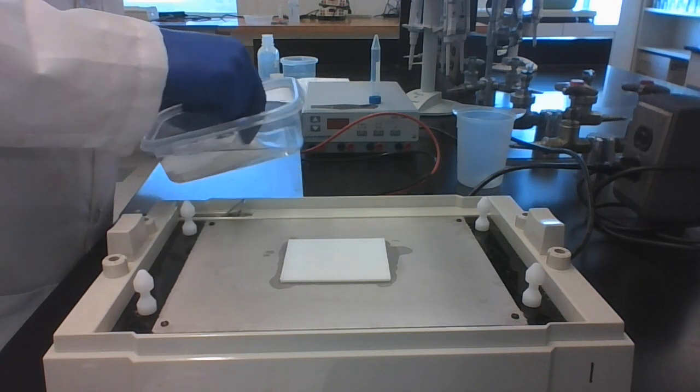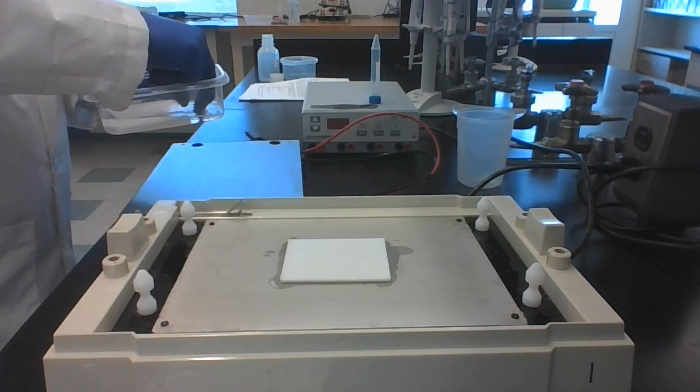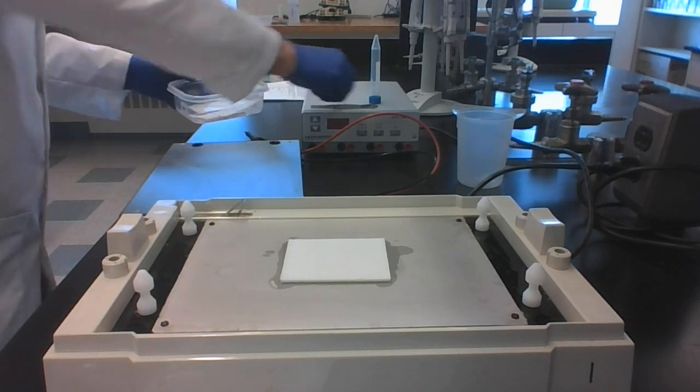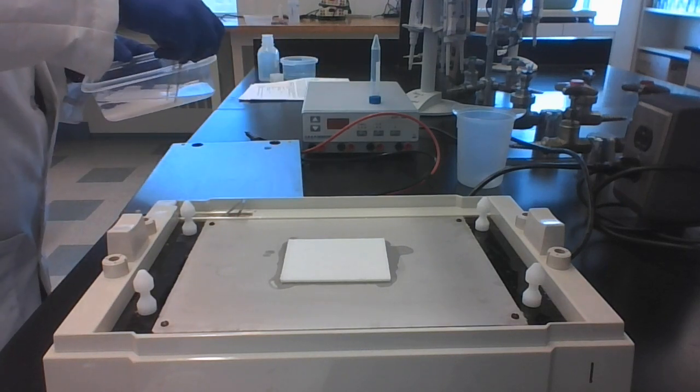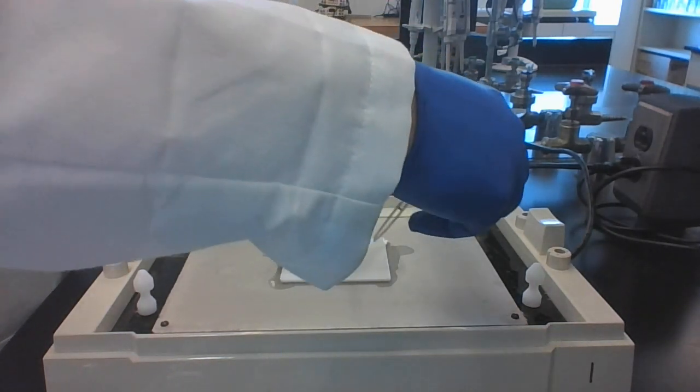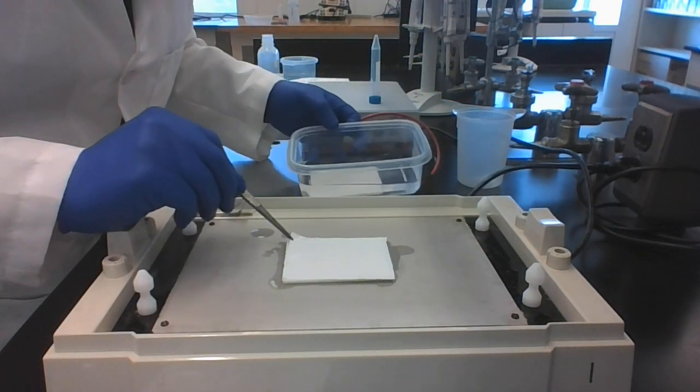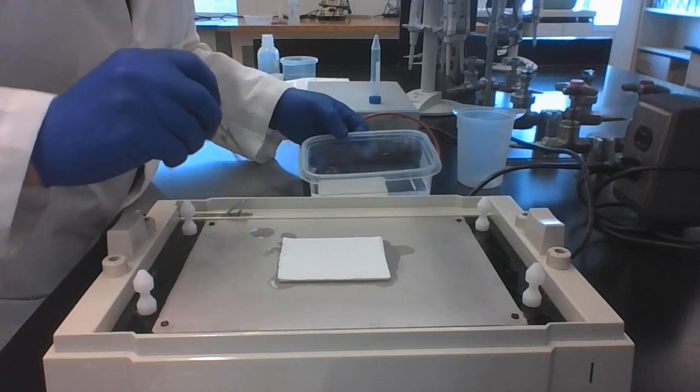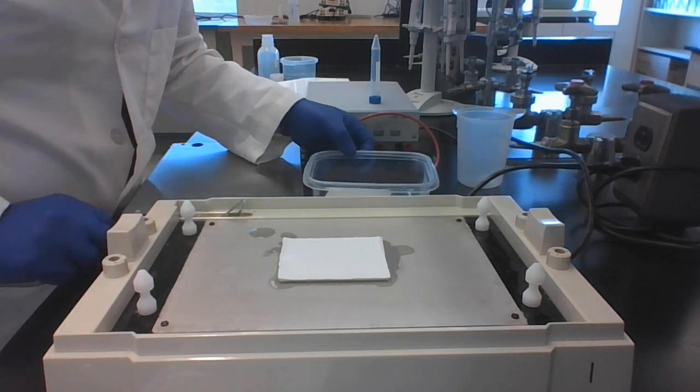We then need to get our membrane, our nitrocellulose membrane, and that goes on top. And then the gel goes on top of that.